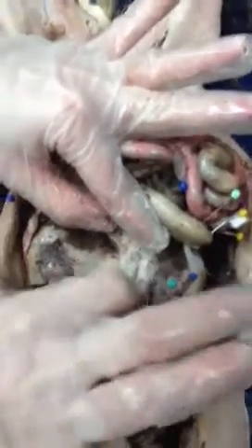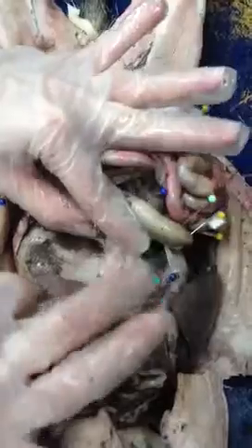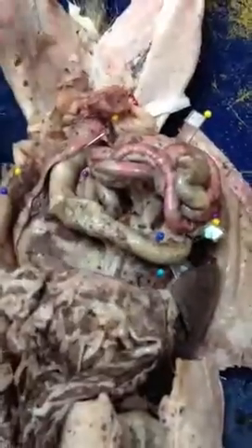All right. Then, the blue right here is the pancreas. It not only goes down here, but it also goes across. All of that right there. Okay. The small intestine has three places.